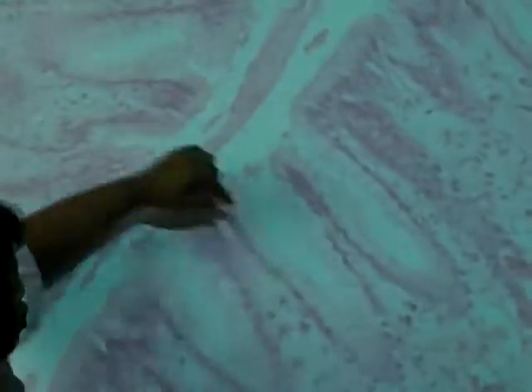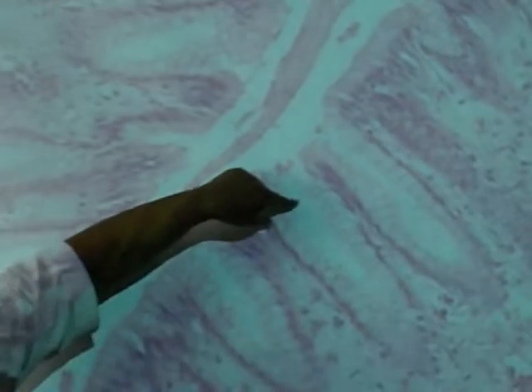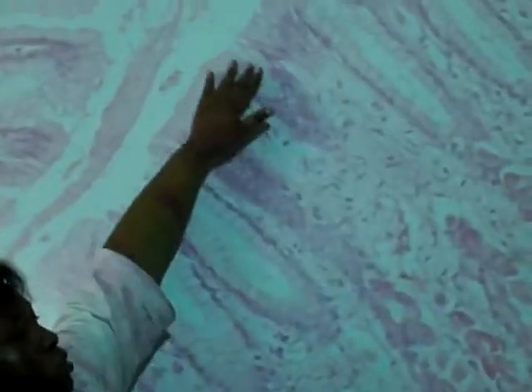The glands that I was telling you guys about are at the very bottom. But the actual space between each of these hills or extensions here are the gastric pits. So where the rugae are, that's your mucosa.